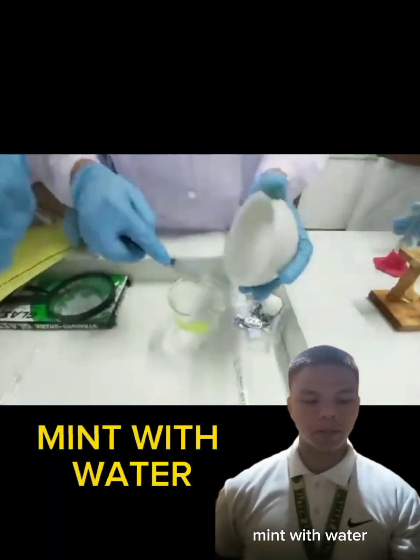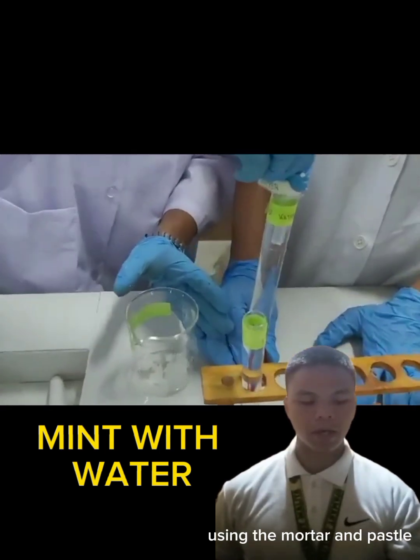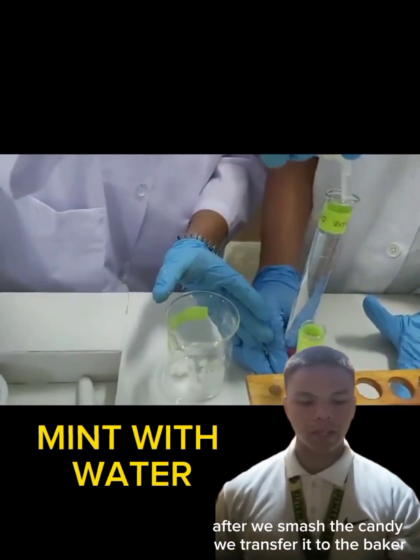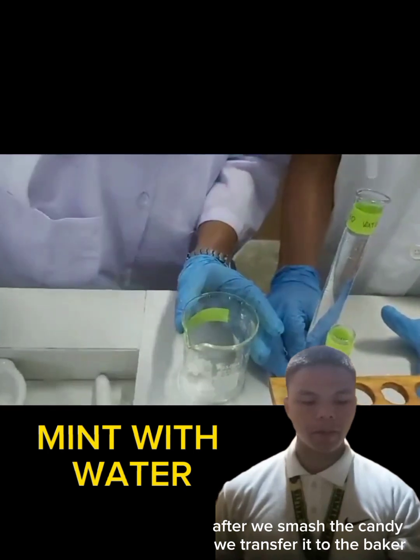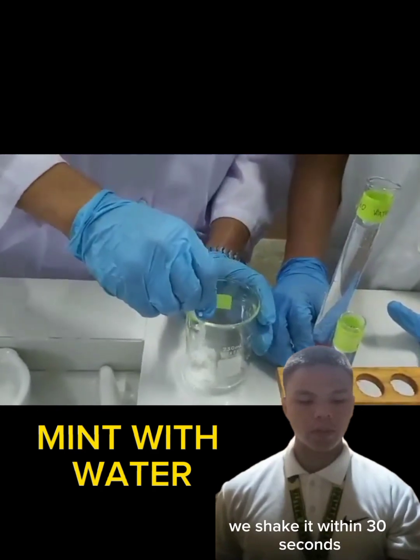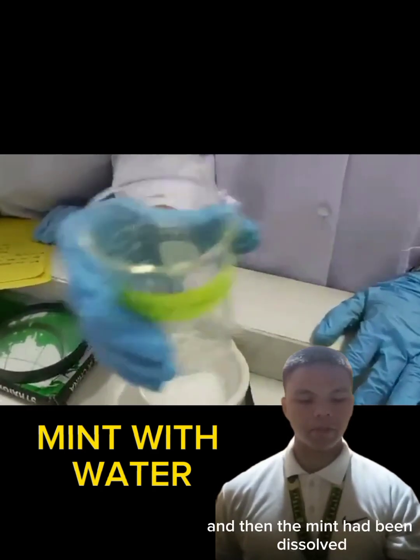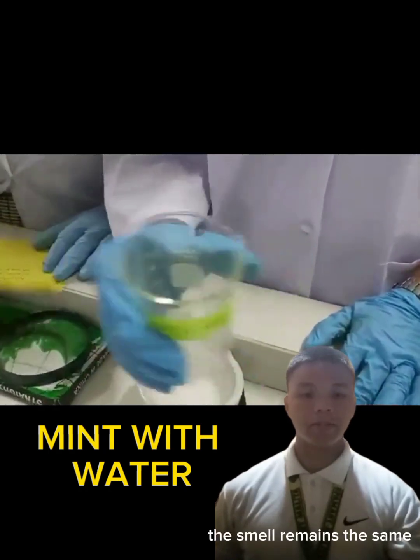Mint with water. It takes time before we smash the candy using the mortar and pestle. After we smash the candy, we transfer it to the beaker. After that, we add 8 drops of water. We shake it within 30 seconds. And then the mint had been dissolved and the smell remains the same.